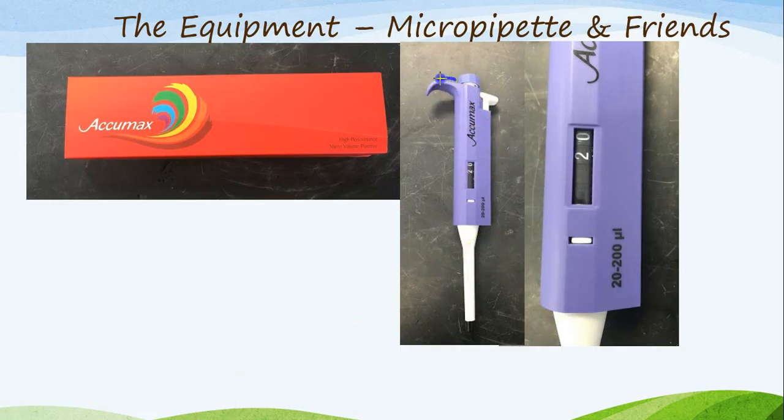You have a hand rest. You also have a micropipette tip ejector. When depressed, this button right here will cause the white portion of this micropipette to extend forward, pushing the tip off of the micropipette. Something you also need to know is our micropipettes have a double function to them. Not only does this plunger up top right here actually change the amount of substance when it is twisted, when you depress it, it will draw up a substance.